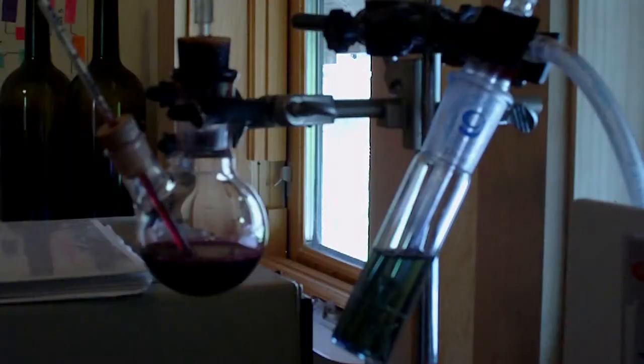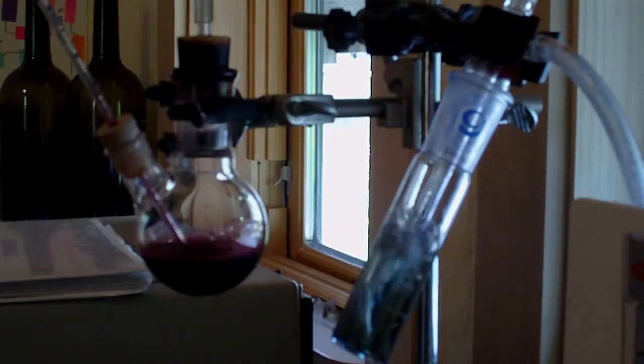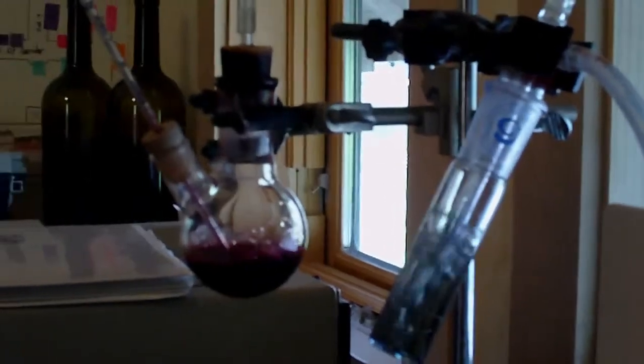Just run this for two minutes and there it goes. And so you'll see that this will turn purple after a few seconds. Very mad scientist. The AccuFlow 5000. See, when we turn it back on.